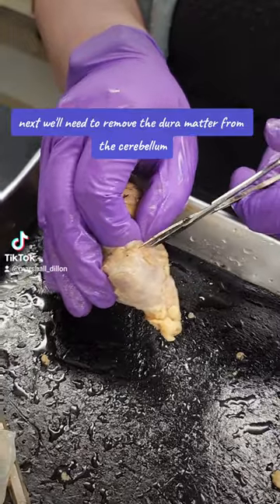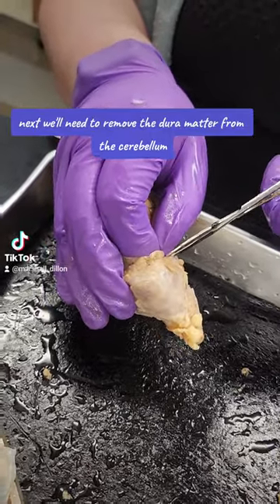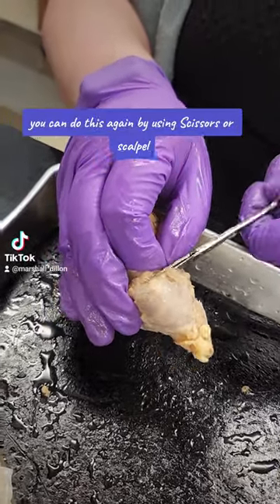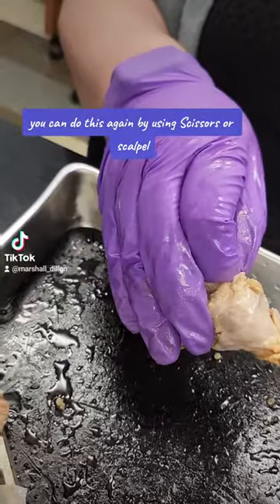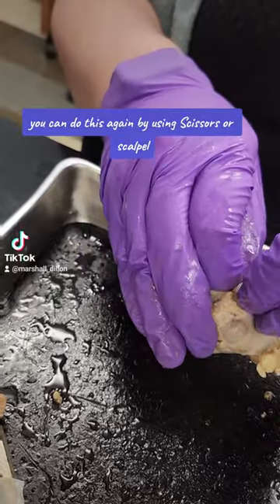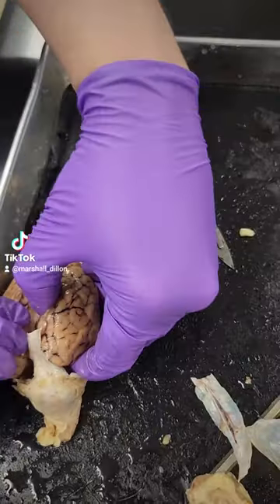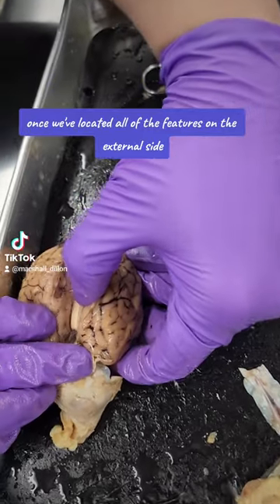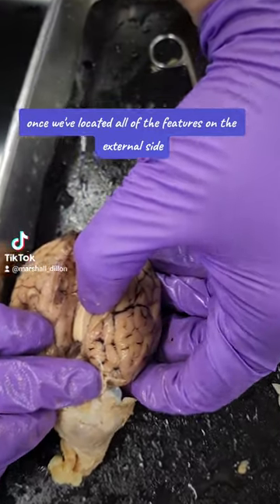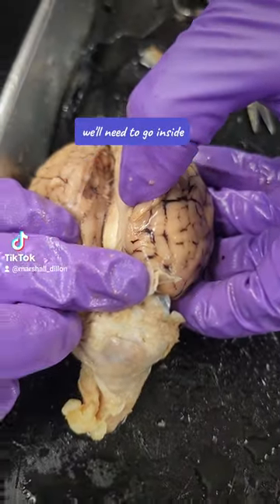Next, we'll need to remove the dura mater from the cerebellum. You can do this again by using scissors or a scalpel. Once we've located all of the features on the external side, we'll need to go inside.